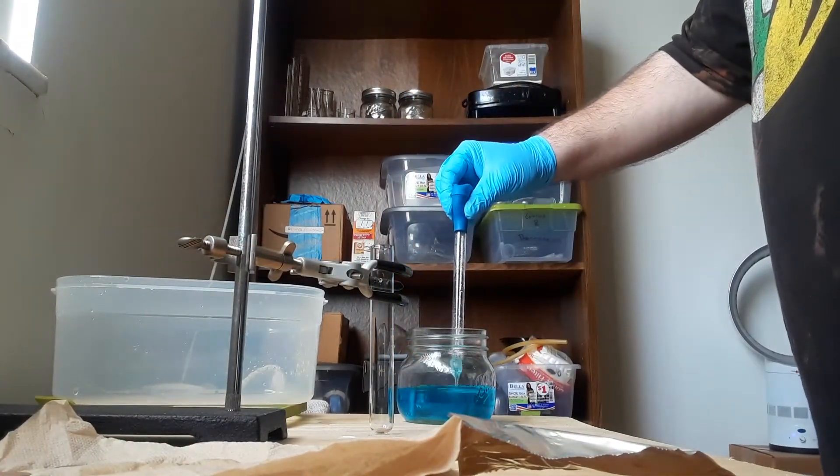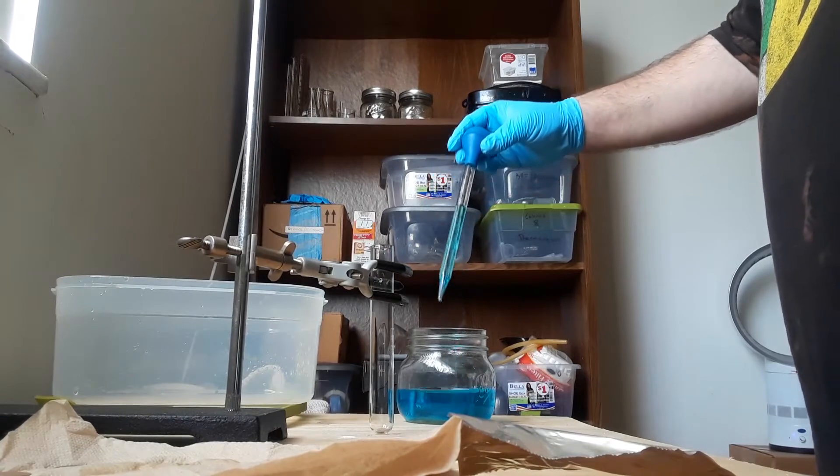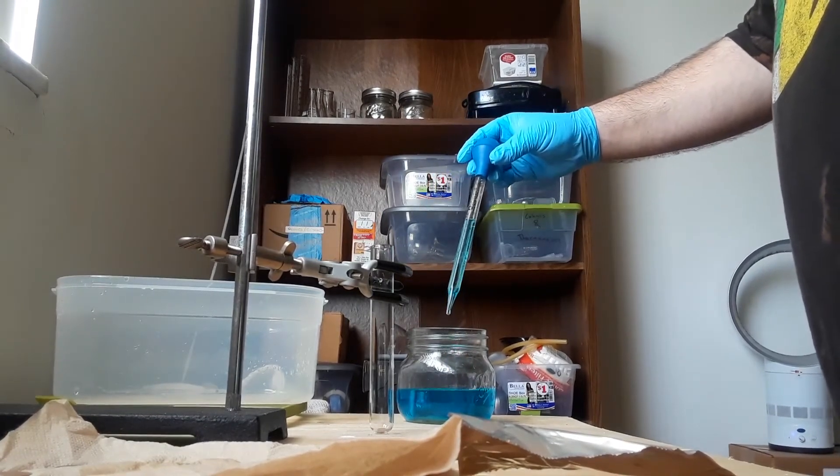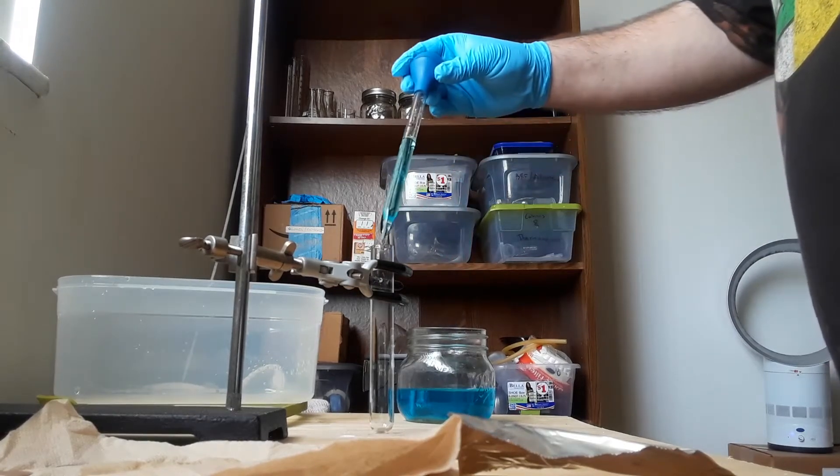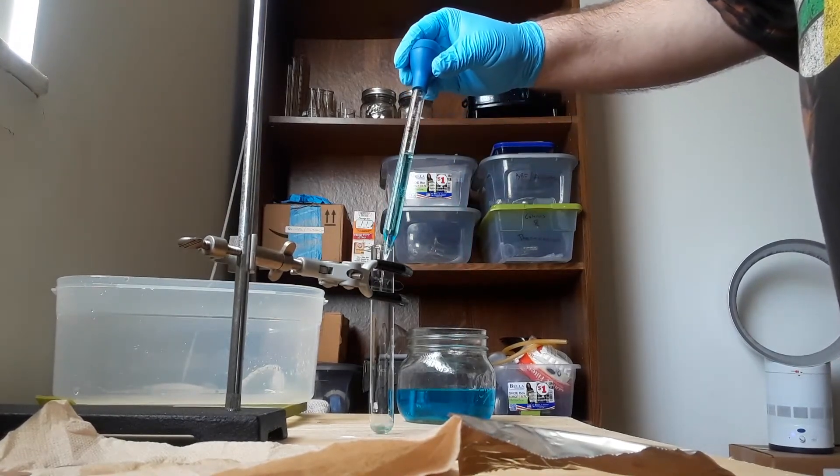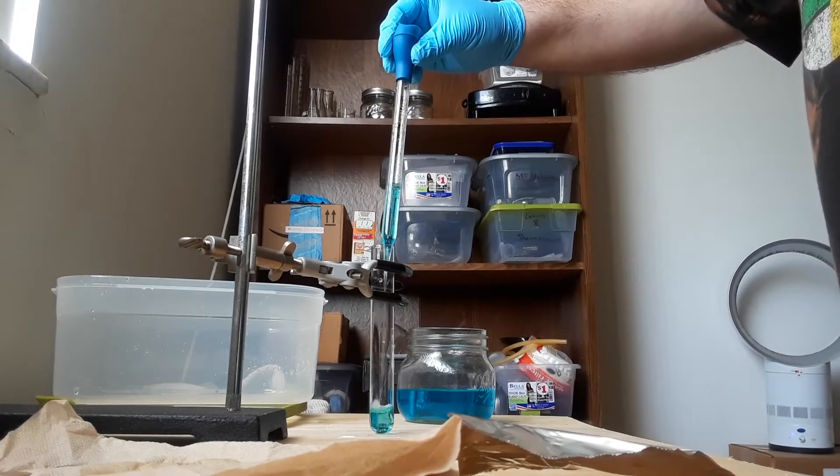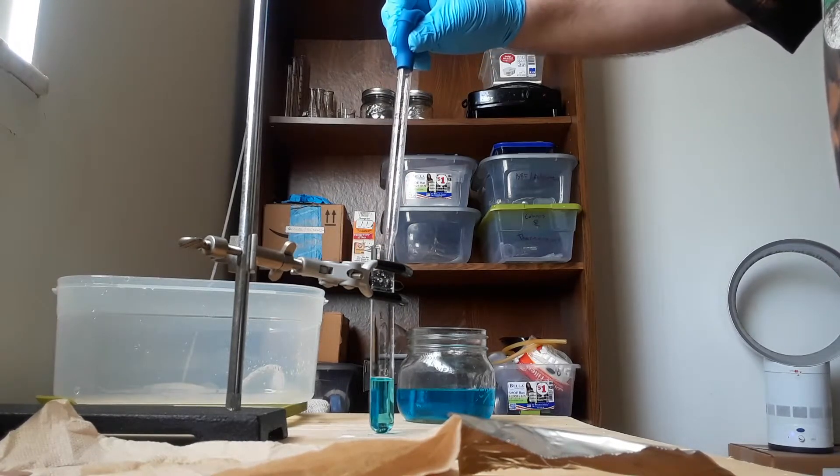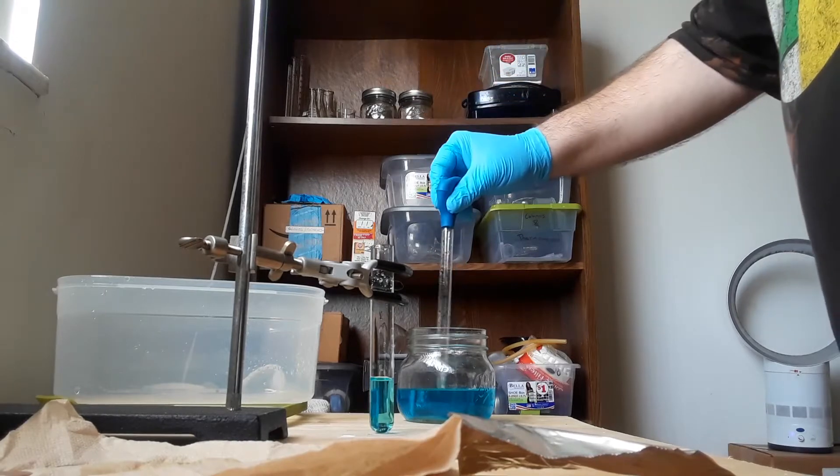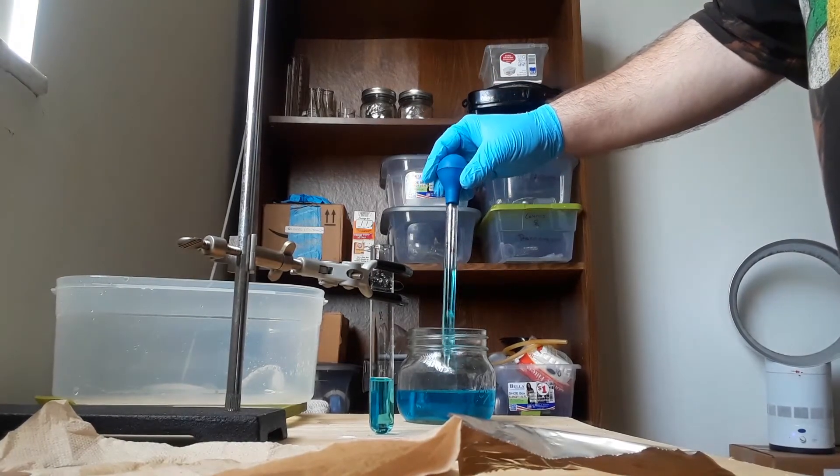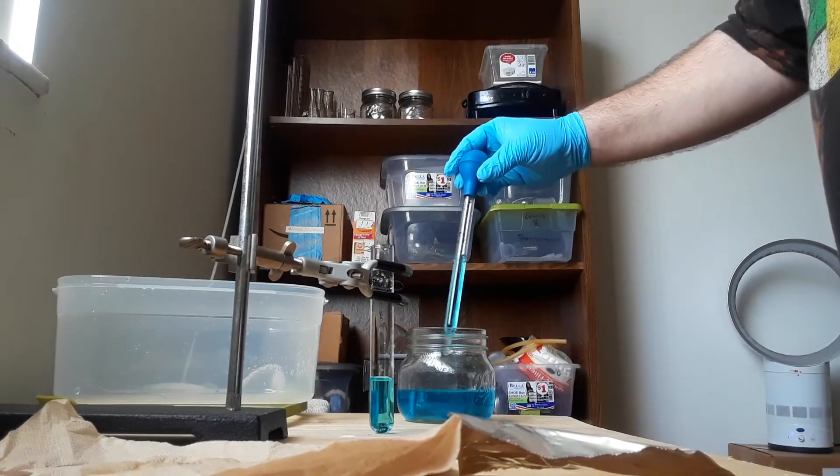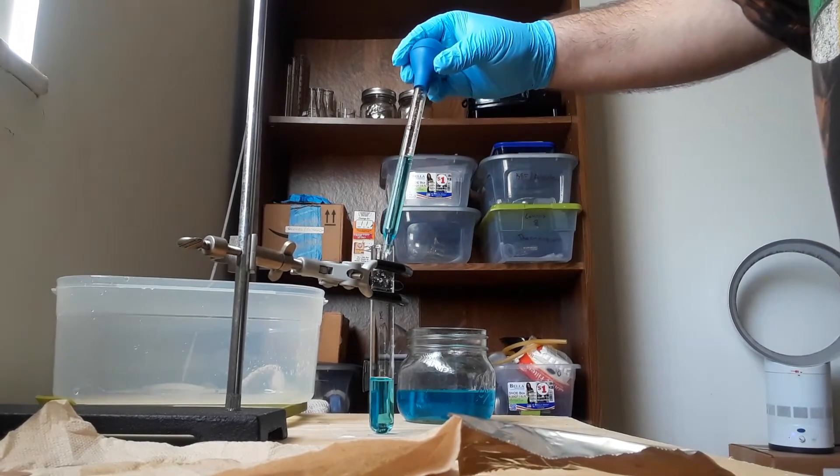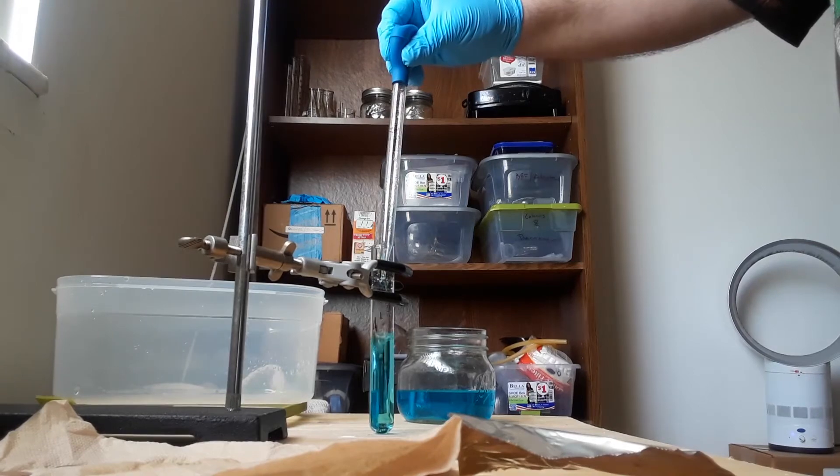I'm just going to add an arbitrary amount. That might be too much. There's not going to be very much copper because this is from like five or six pennies, so we're looking at maybe five grams tops.